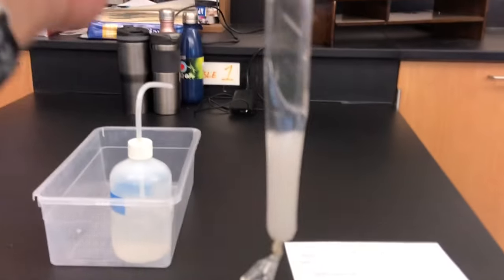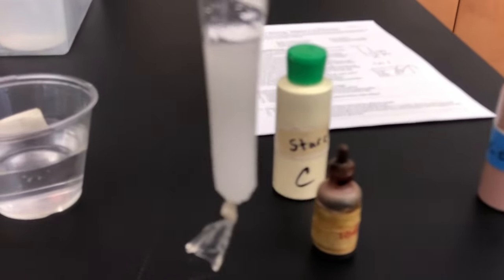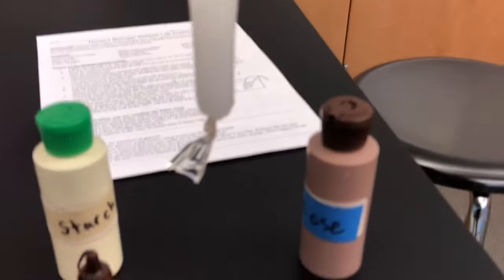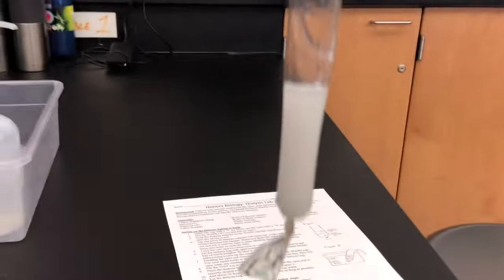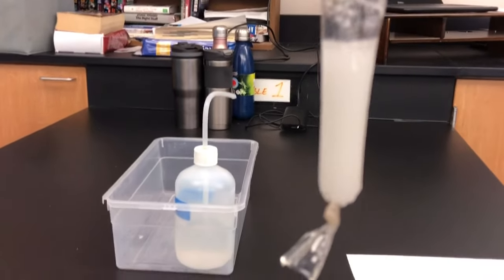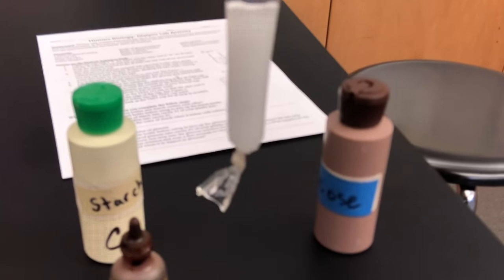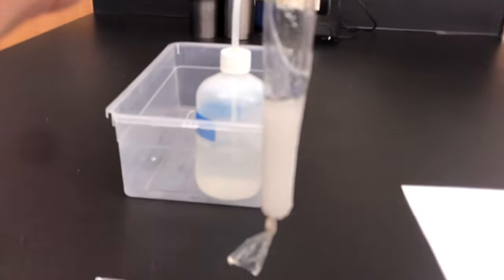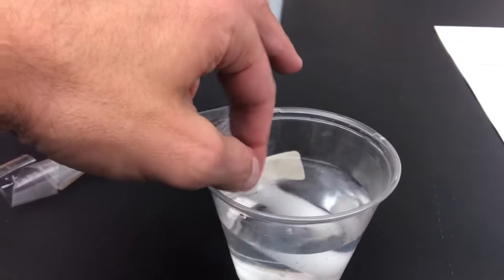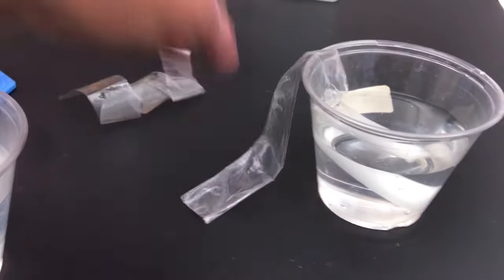Okay, I'm back. What I did was I took the dialysis membrane and using a graduated cylinder, I added five milliliters of starch and five milliliters of glucose. So right now there's about 10 milliliters inside of this dialysis membrane. I'm going to put this dialysis membrane in this cup of water and make sure it's submerged. The open end is just dangling outside the cup.